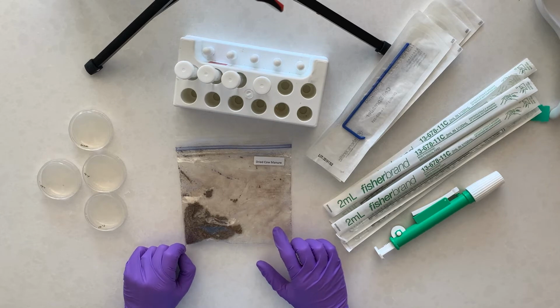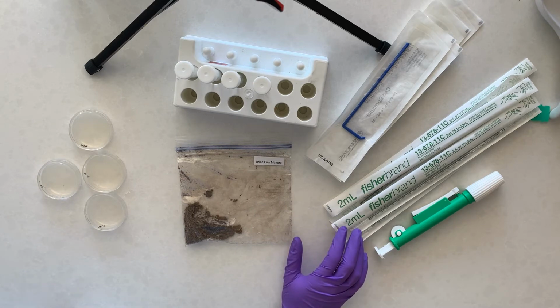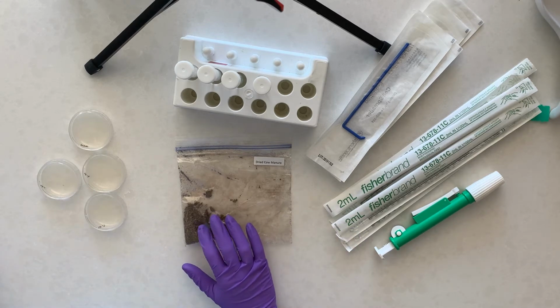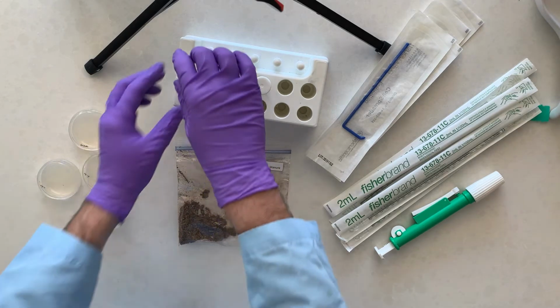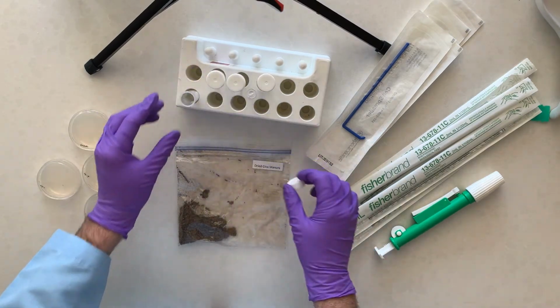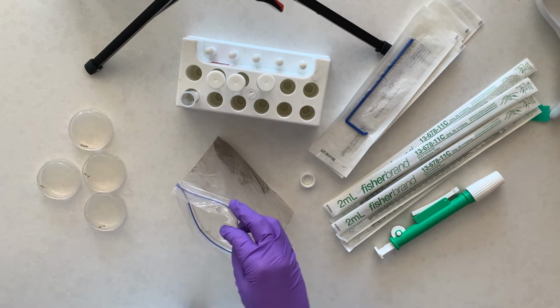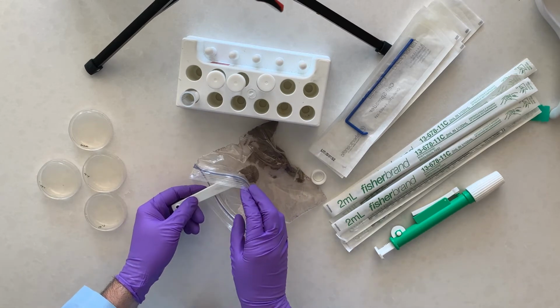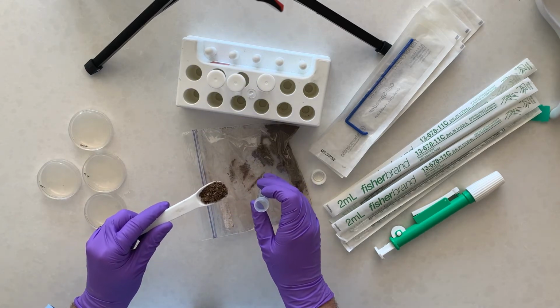This cow manure, you're supposed to use about a teaspoon amount. If you go to your original table of what you're supposed to have, this is more than a teaspoon. I don't know if you necessarily need to measure it, but I just don't want to dirty a teaspoon of mine with cow manure. Transferring this might be a little tricky, so let's go ahead and use it. This transfer is going to be a little messy.